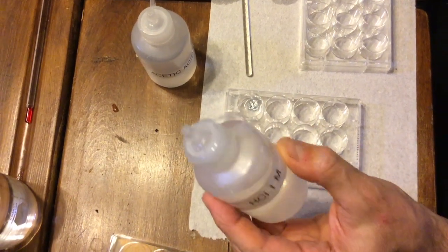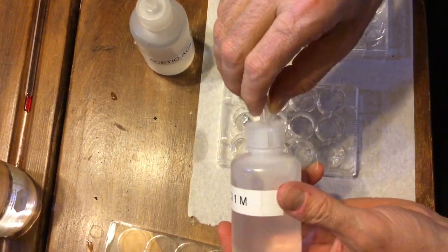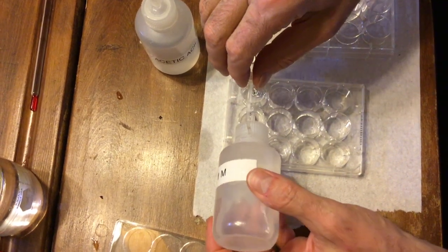Now I'm going to do the same thing with the hydrochloric acid, and you observe if they're the same or different.